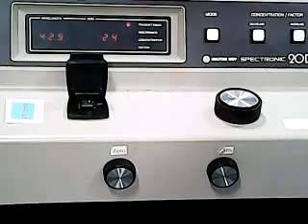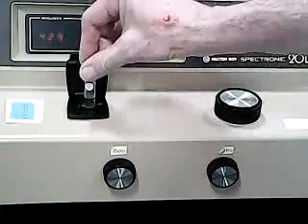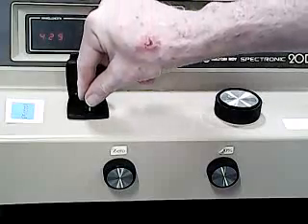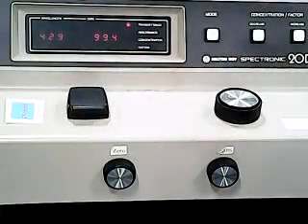That is, that might have some small absorbance themselves. So we have made the same solution as we're going to use in the test solutions, but we've made it without the iron plus 3 in it. And now we'll see what reading that gives. As you can see, the reading from our test solution itself without the iron in it is in fact a little less than that of the distilled water.